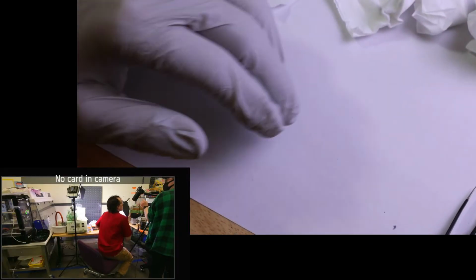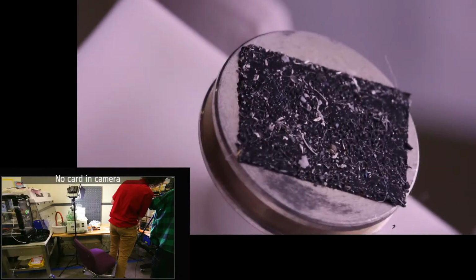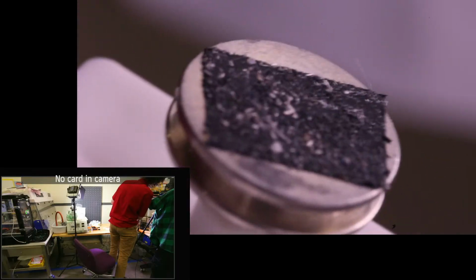I'm going to bring it up real close. Here, I'll just move it from here. So there's a bunch of stuff from the Merlin chamber. I think that looks like a pretty good sample to me. What do you think? Yeah. Lots of whatever that is.